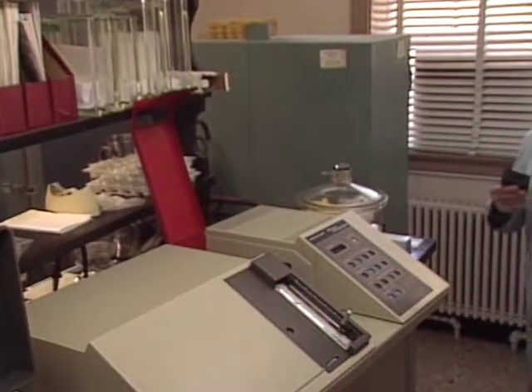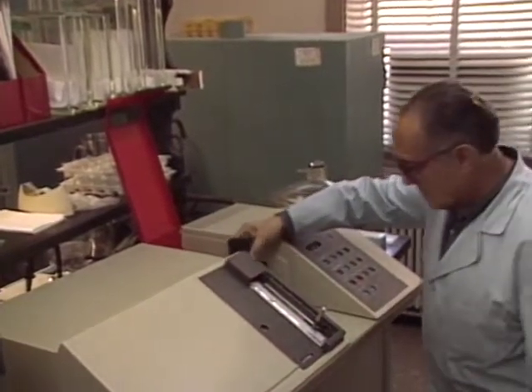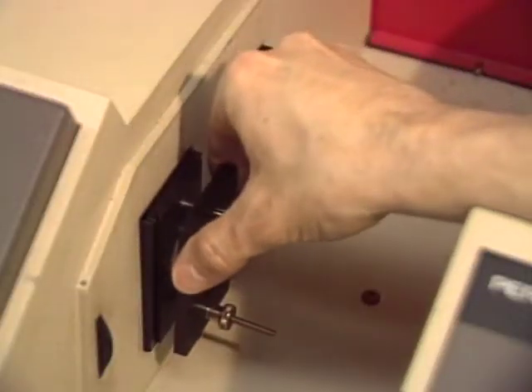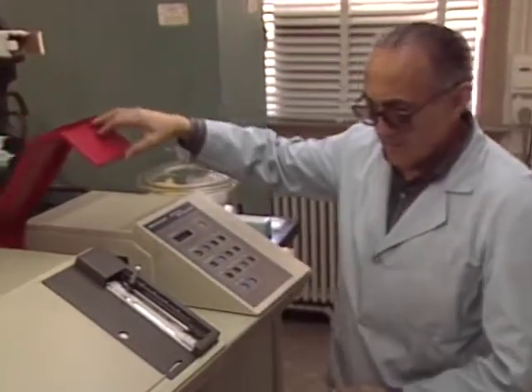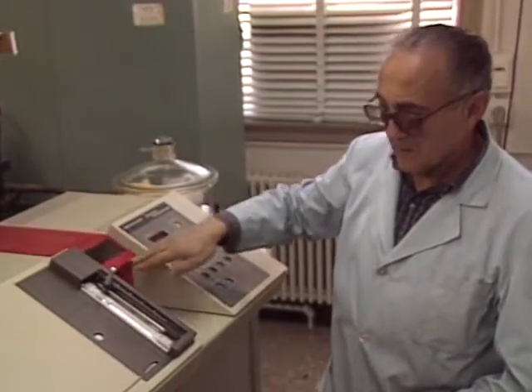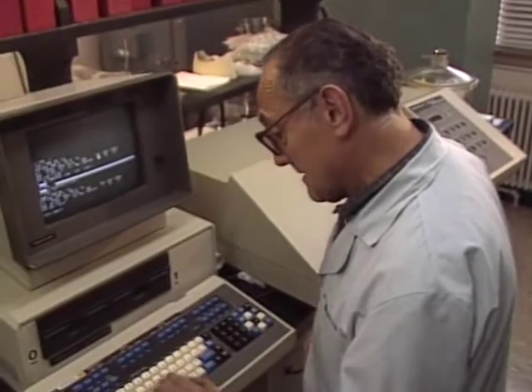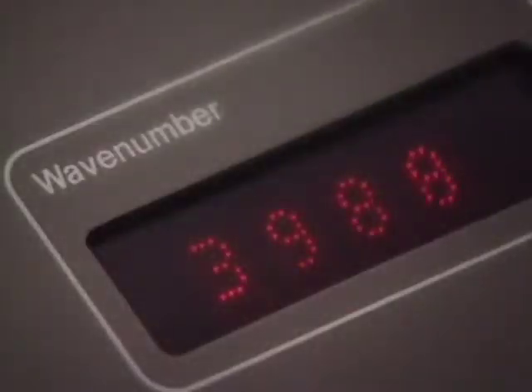An important part of Dr. Schwartz's work is confirming that he's made an exact copy of the natural chemical. He uses infrared spectroscopy to verify the structure of the molecules he's tried to duplicate in the lab. The spectrometer sends a range of infrared frequencies through the sample, and the spectrum on the screen reveals important characteristics of the molecule's structure.